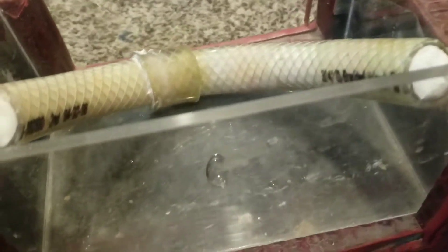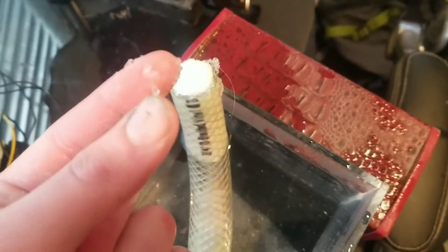You take a pad and tear it apart to get at the center part — it's cotton infused with sodium polyacrylate. Then you take another one and do the same, and roll them up. This has fully been stuffed with diffusion materials. I'm going to fill this thing completely with water to let it fully saturate. I also superglued this so that it's a little tighter. Our diffusion membrane is going to fully saturate with water — you can see the gel already forming. The gel is sodium polyacrylate water lock and it is going to act as our diffusion membrane for the experiment.